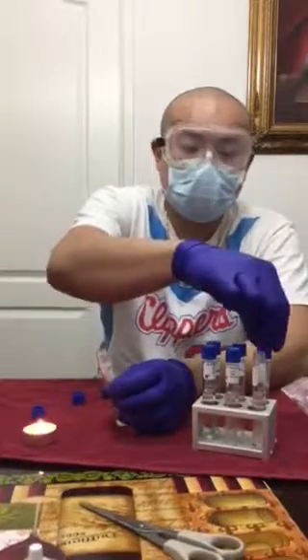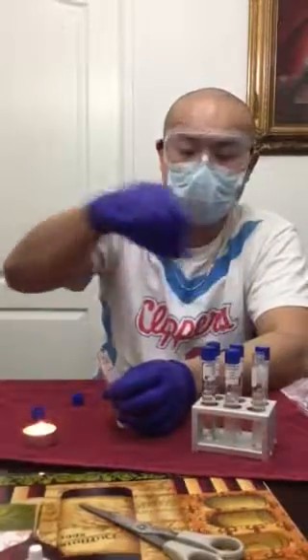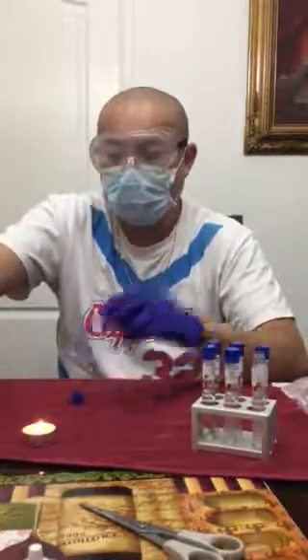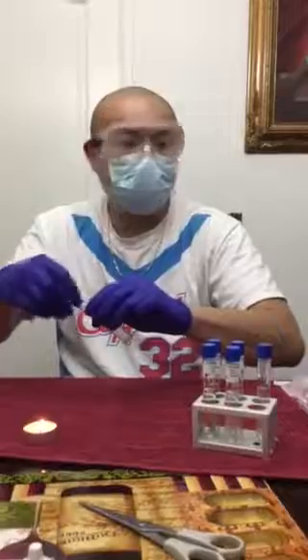I also repeated these steps for the cerevisiae too, for the 1% NaCl, the 7%, and 15%. Also, I want to add, before I recapped everything, I also sterilized it and then recapped it. So after I did all those steps, I put it in the incubation period for 48 hours. And basically these are the results.